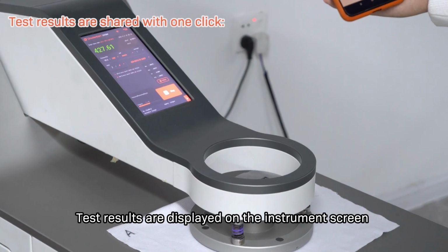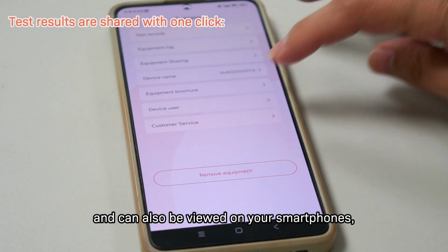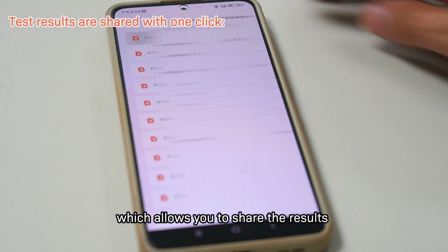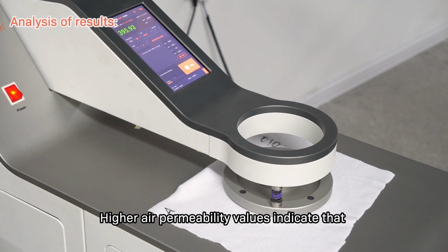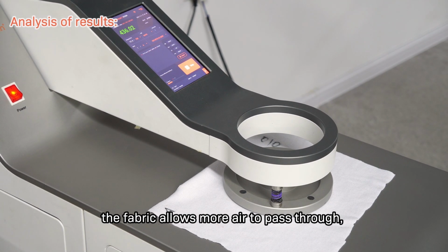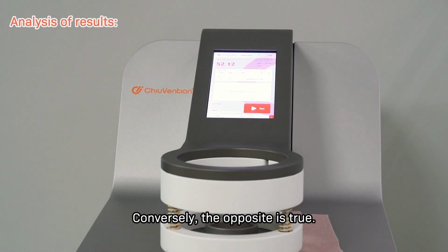Test results are displayed on the instrument screen and can also be viewed on your smartphones, which allows you to share the results with the quality control department or brand buyers. Higher air permeability values indicate that the fabric allows more air to pass through, suggesting better breathability. Conversely, the opposite is true.